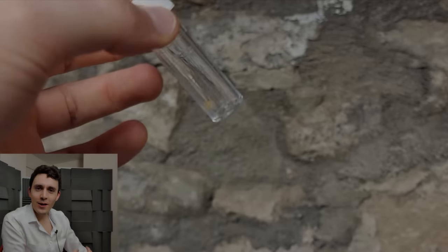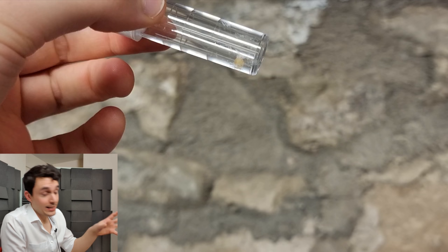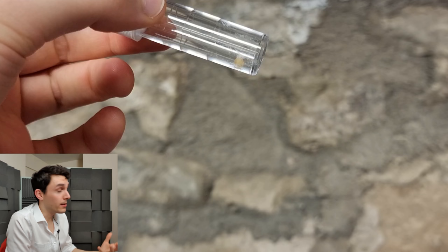Hey everyone, it's Connor here again and welcome to what may very well be the final update of this saga. So this is the dead skin case again. What we have in the little tube here is just one of the little globules of dead skin that I harvested from the patient in the previous video.